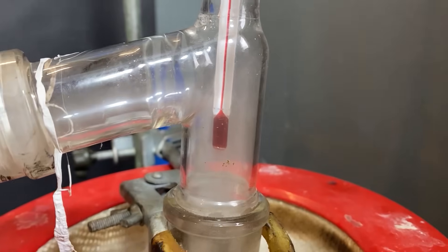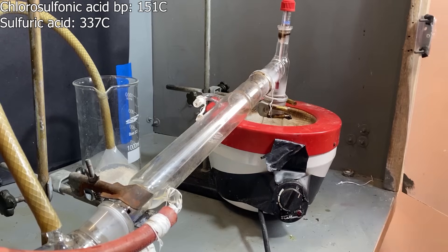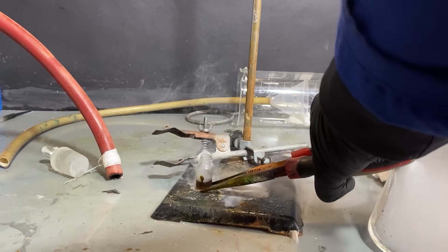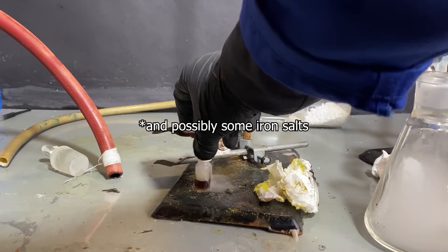After that was done, I distilled the newly made superacid. This distillation was really easy to carry out, since the acid itself has a relatively low boiling point. Finally, I bottled it, and absolutely no disaster happened here. Now that we've got around 2ml of chlorosulfonic acid, which was apparently discolored due to some plastic contamination from PETE plastic, we can begin the second step of this procedure.